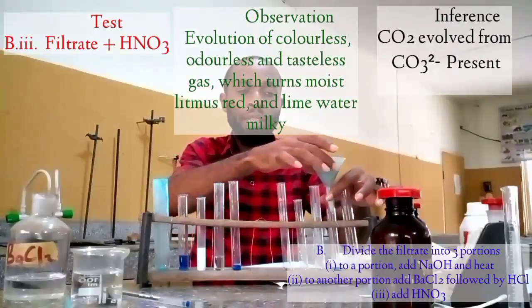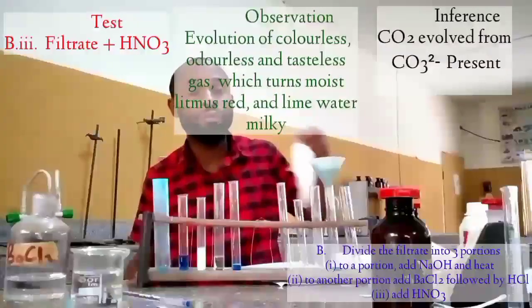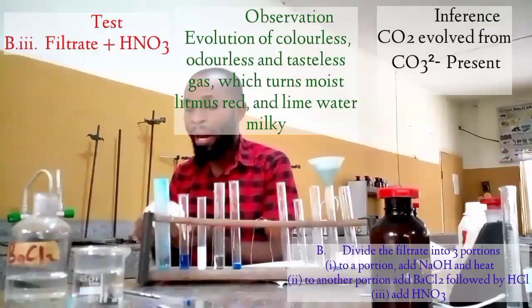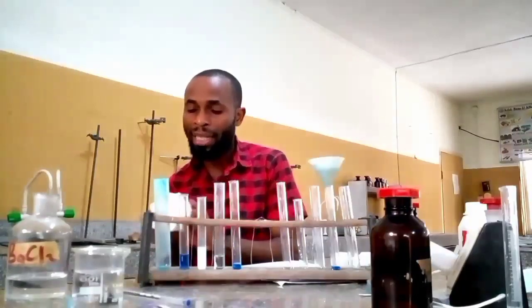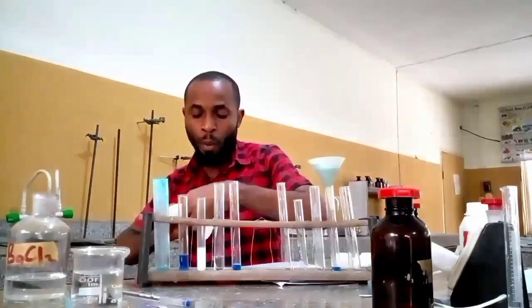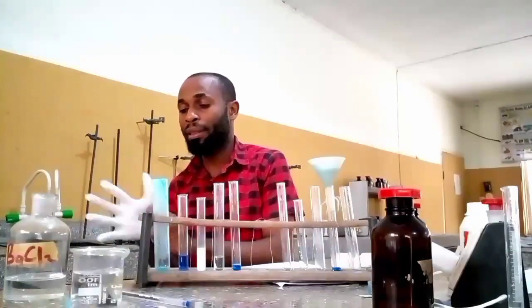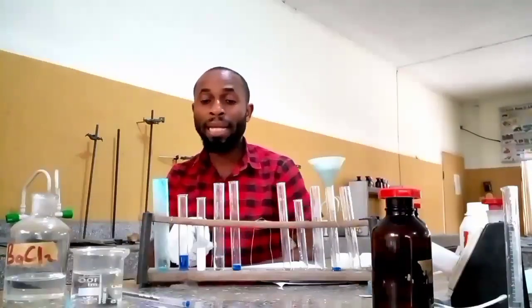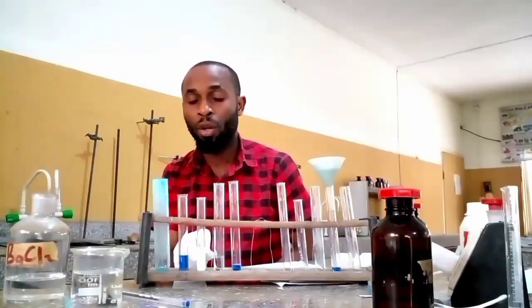Now I'm going to keep this. I'm going to bring out the filter paper and make out my residue. It's the residue we want to work on. And I believe it's the residue that WAEC is actually going to ask you more questions on than the other, because it contains simple ions, unlike these that contain more than 2 ions.